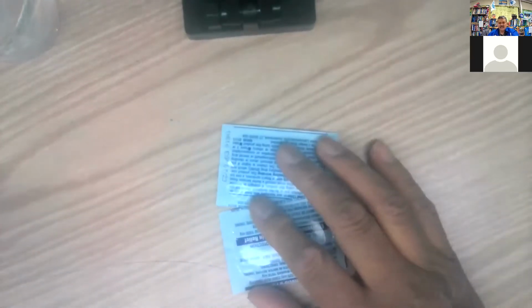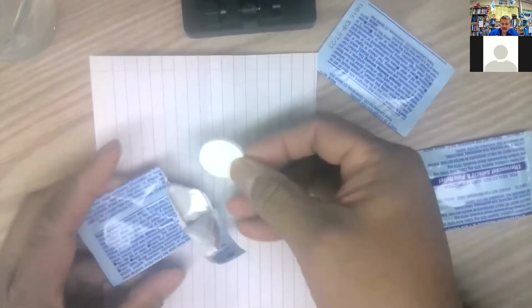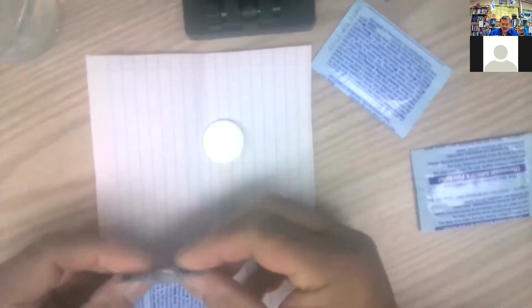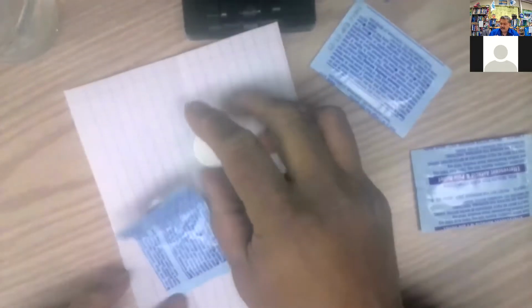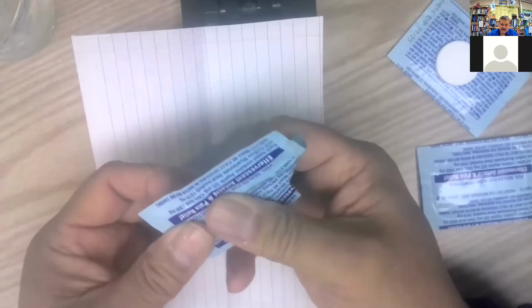Remember, there's a twosie, a threesie, and a onesie. So I need 3 of these. And I'm going to open one of them up. Put the paper underneath here. And open these guys. Take one tablet out. It's 2 per package. So I wanted you to see that. So I've got a tablet in there. I'm going to save this for my other one. Okay. And you could probably snap it here.